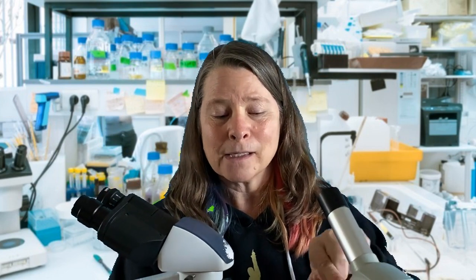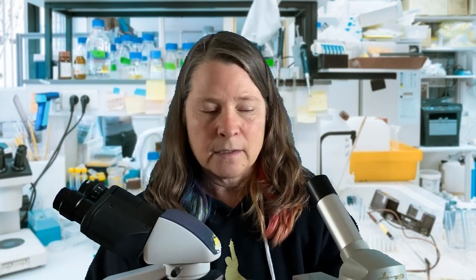I'm going to do a couple of things because I'm going to have my son look at some stuff and describe it just for a couple of little things. Okay, so most of this, when you see it, you're going to be seeing it through this one. It's got a higher power of magnification, which we will get into. It's a little bit different.